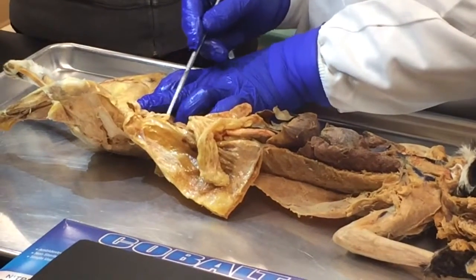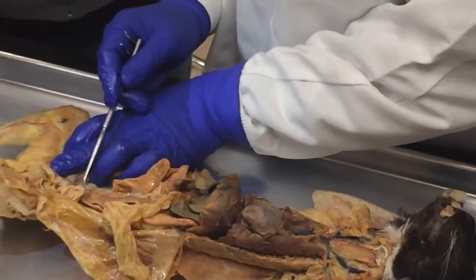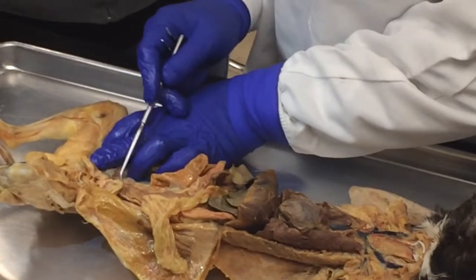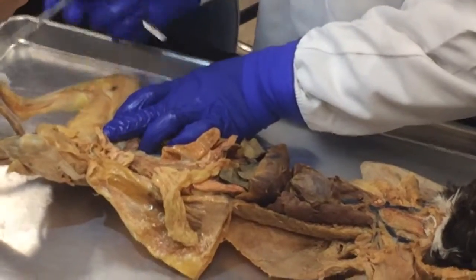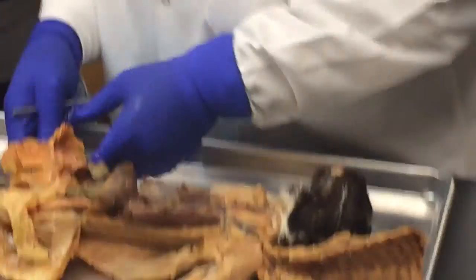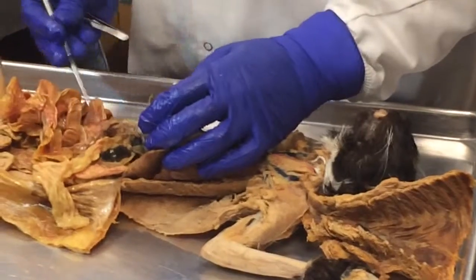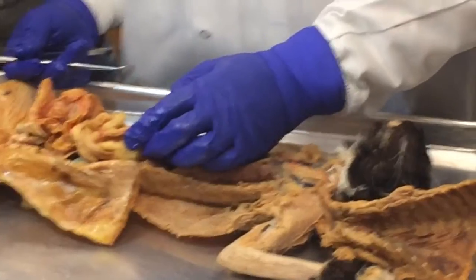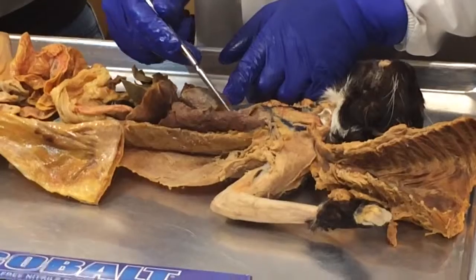And you see, if I put a sticker right close to the pubic area over there, that would be the rectum. Okay. This up here would be the descending colon. You can see the rectum is already getting distended with fecal matter here. And then you get the defecation reflex and so forth. So that's all the small intestine and colon and liver and the stomach parts and the other accessory glands like the pancreas, and the spleen is not really an accessory for the digestive, but we just do it because it's there.